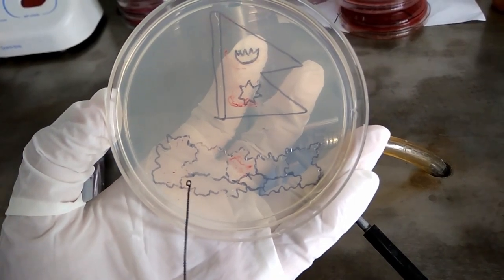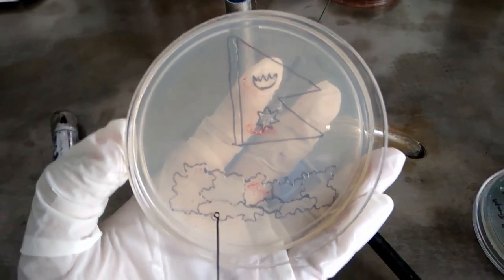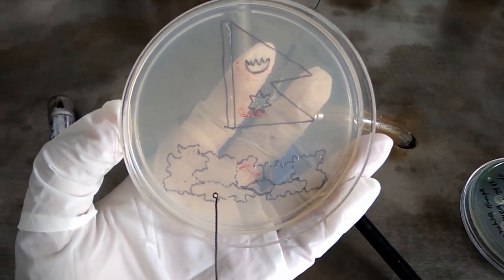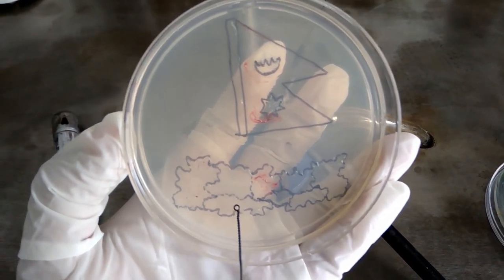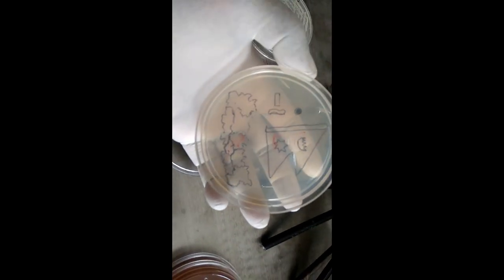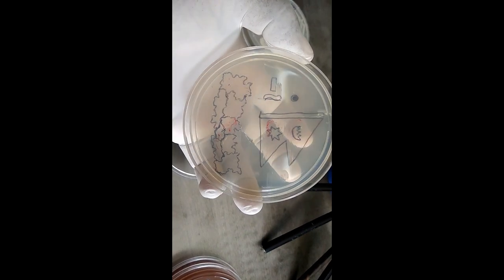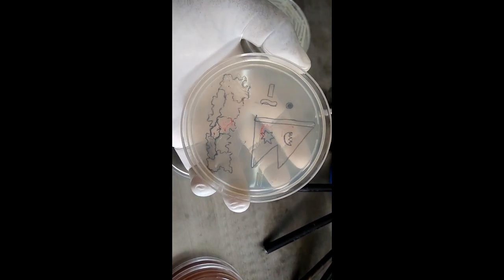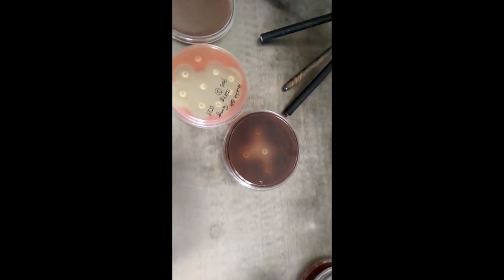Another most important thing is that pigments of Pseudomonas aeruginosa are diffusible in the medium, so use this organism in less amount, because even in a small amount it can affect other organisms' color expression in your agar art, and over a longer duration it can easily spread throughout your agar.